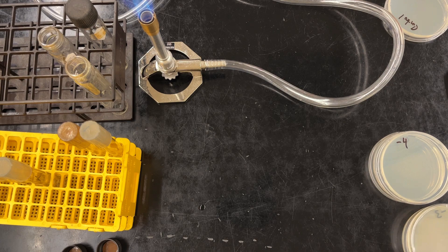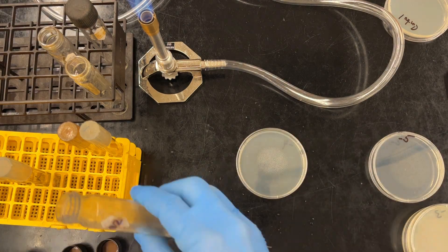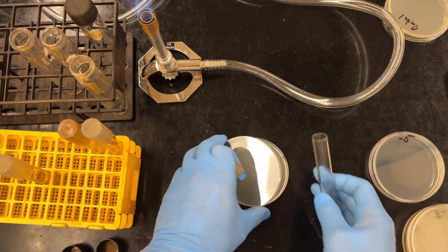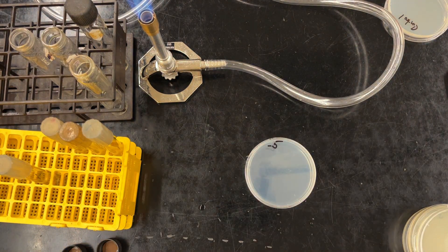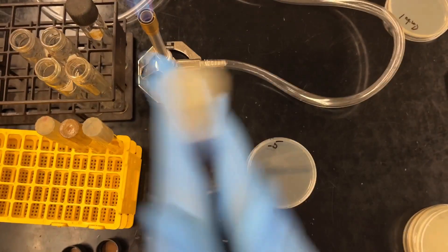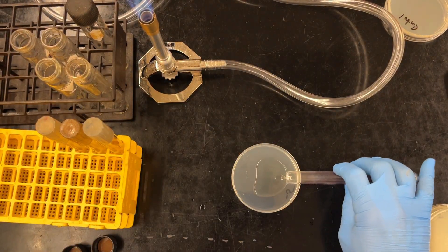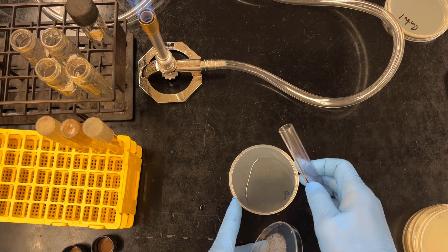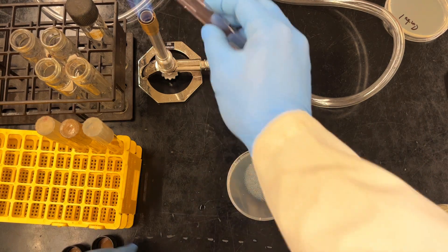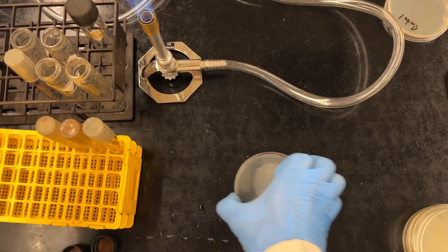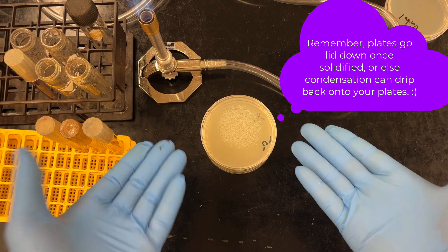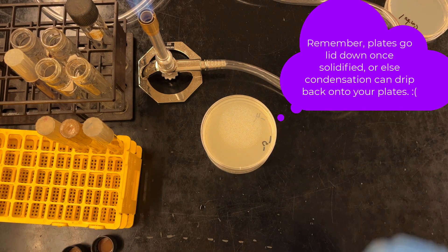Repeat the process for all five plates. Sorry, we will use four as a group. So repeat the process for all four plates. And then that's the whole protocol. Again, just want to reiterate that because these things solidify so fast, just make sure that you are prepared and you know what you're doing. And then nice little swirl, and then that's our last plate. And we're done. Stack your plates, wait for it to solidify. Into the incubator. We will see some plaques the next time. Hopefully.